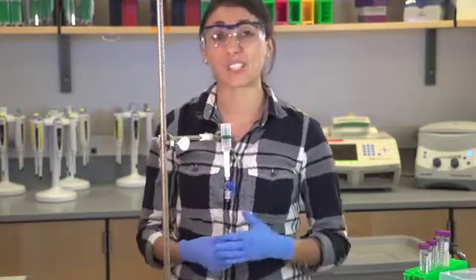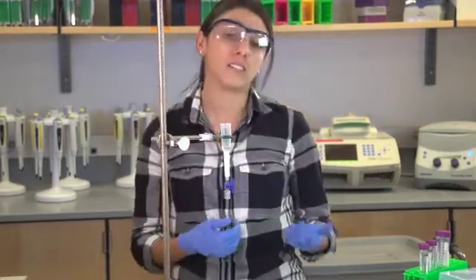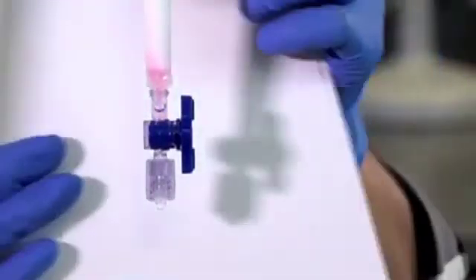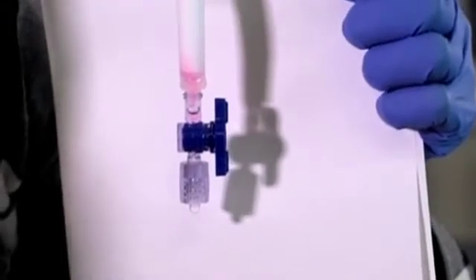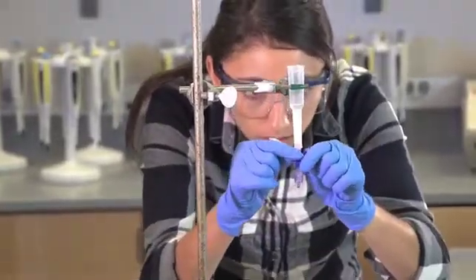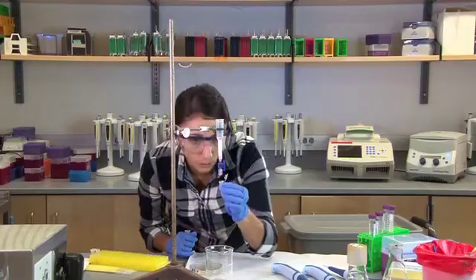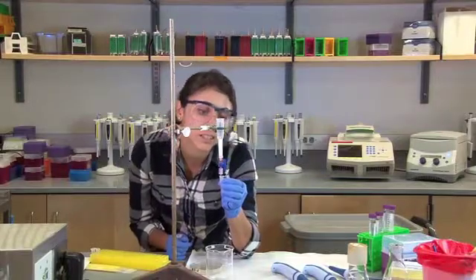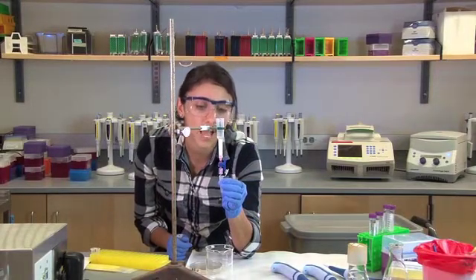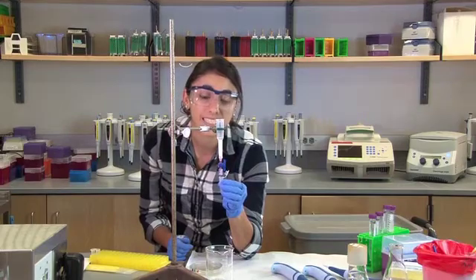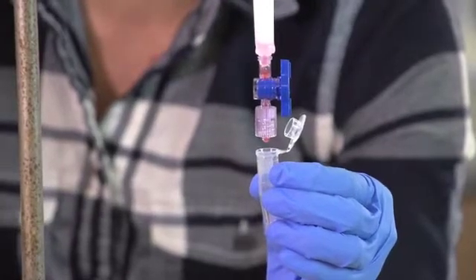So here is where the liquid goes, and now I see that that's pink. So now I could start collecting, or I can see that there's pink right above the stopcock, and I'm going to start collecting into my tube number one. It's important for students to keep an eye on the RFP. Not only that, but just understand what they're doing and why they're doing this in the first place. It's inevitable that this is not the first time that they're doing the ABE labs in class. This is laboratory six, so they've either spent a day, a week, two weeks, this could even be their third week doing these labs.